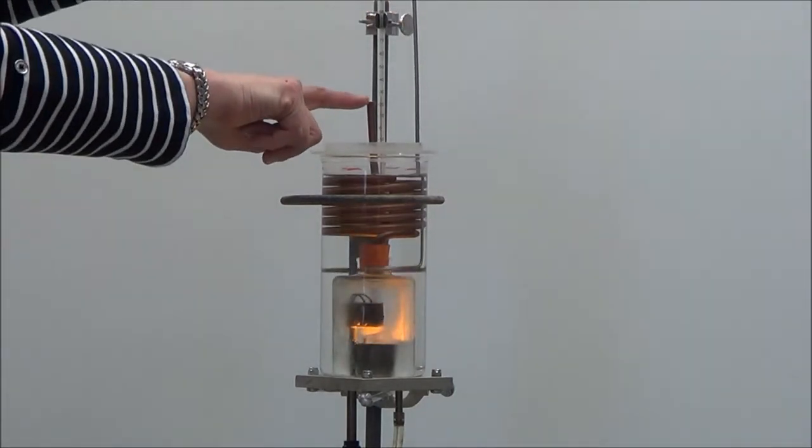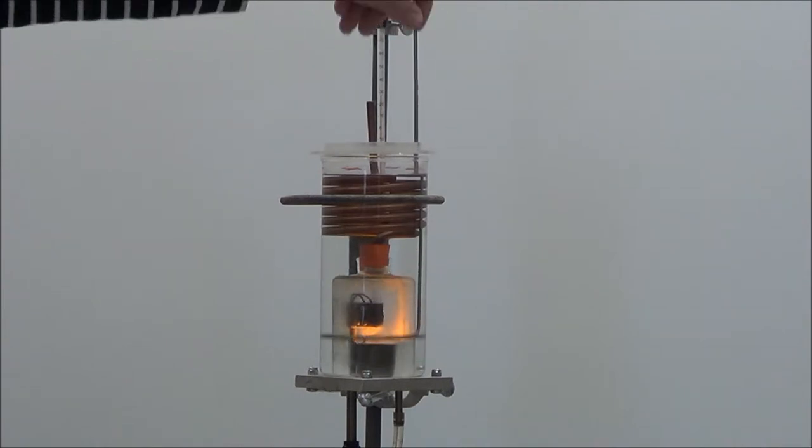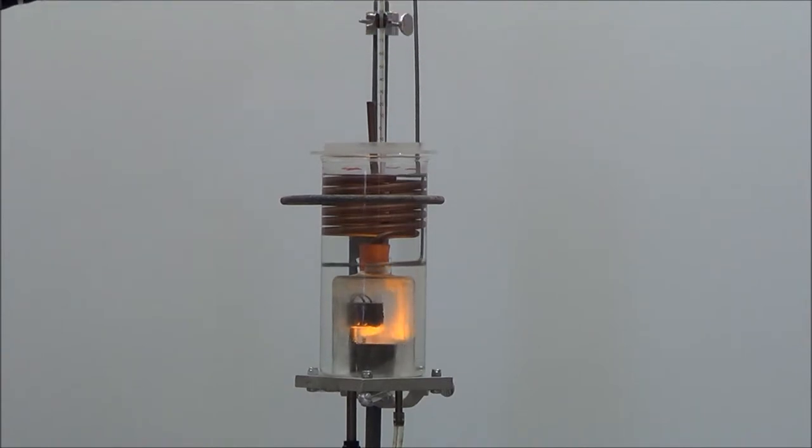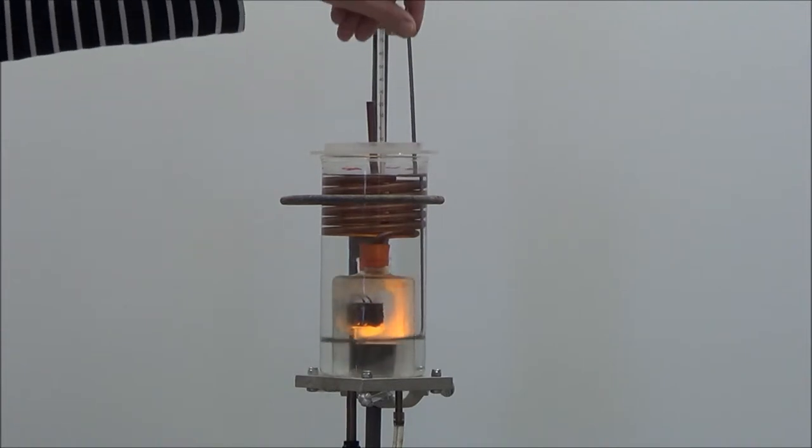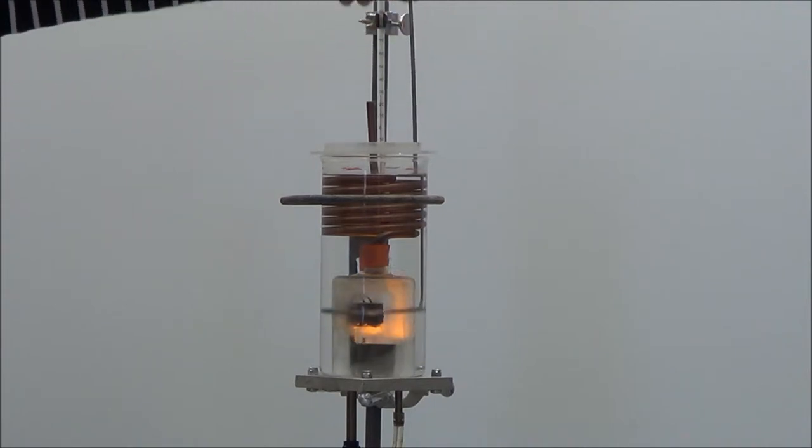If you were close enough, you might be able to see a little stream of steam coming out of there. Temperature is rising in the water. And so we make that assumption in calorimetry that the heat that's leaving the reaction of the bread burning is going to be equal to the heat that goes into the water. That's your Q in equals negative Q out, or it could be Q out equals negative Q in, depending on how you look at it.